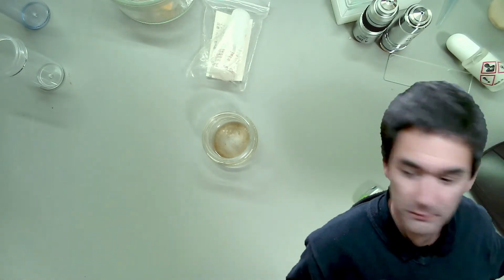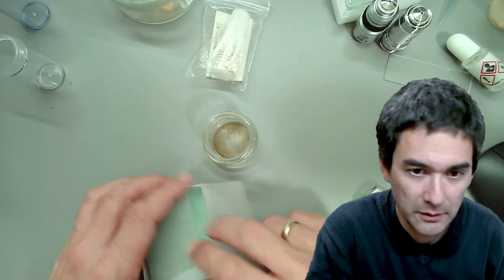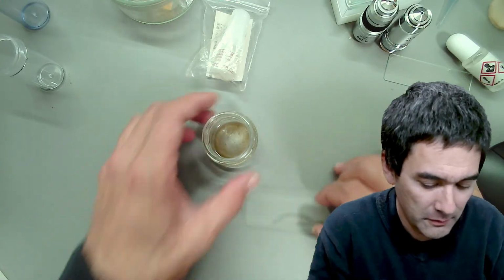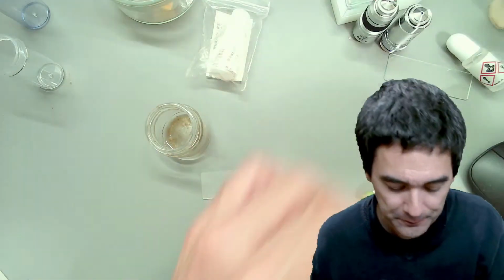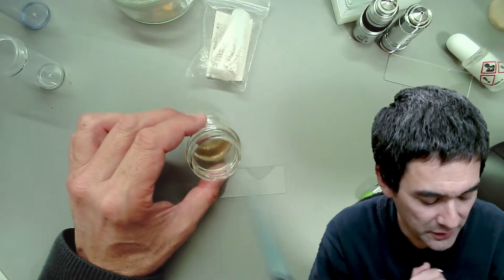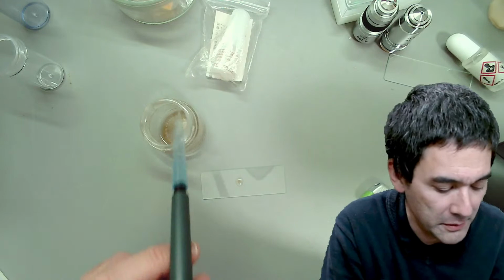So where are my slides? I put my slide box somewhere, and here they are. I'll take a slide. There is really nothing special about this. I will simply use the water sample first. I'm going to take my pipette. I have to admit, I have not tried this sample. There's some solid stuff floating around. I'm a little bit worried that it's still going to be too thick. And I put a very small drop here.